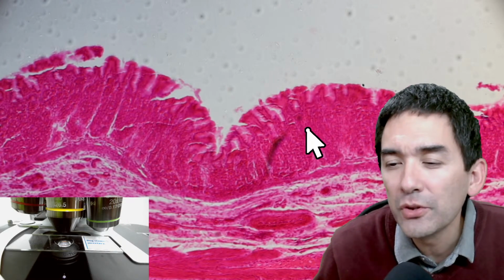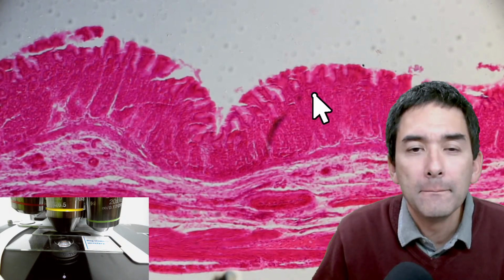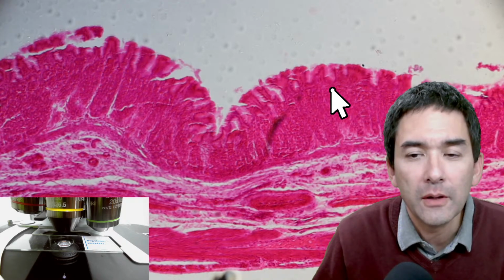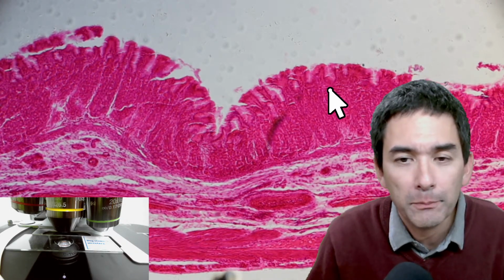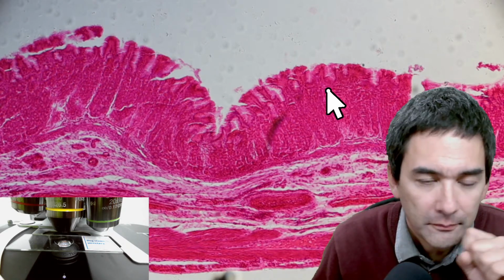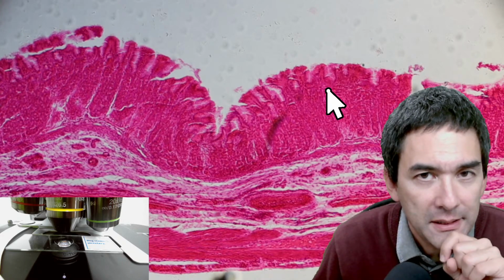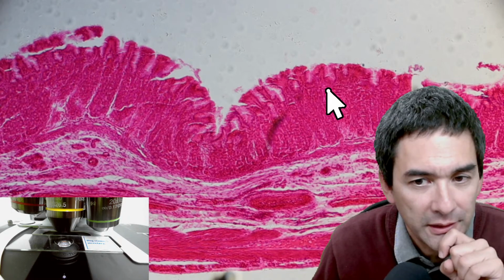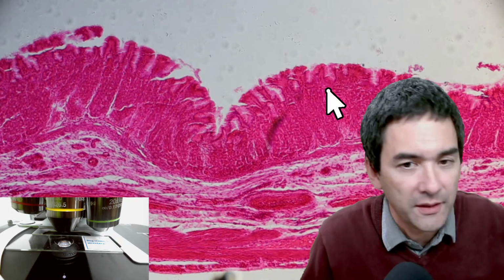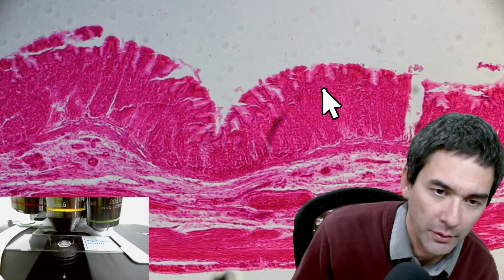Can you demonstrate an ocular micrometer someday? Yeah, an ocular micrometer is a little scale that you put into the eyepiece. And this scale is actually, yeah, but my camera is not connected to the eyepiece, so I have to somehow think of a system where I can actually look through the eyepiece.